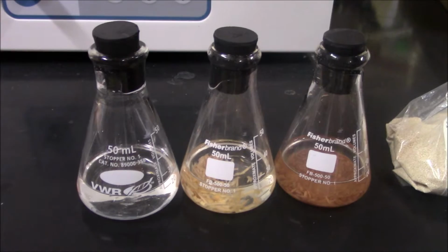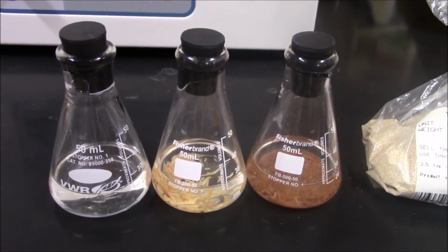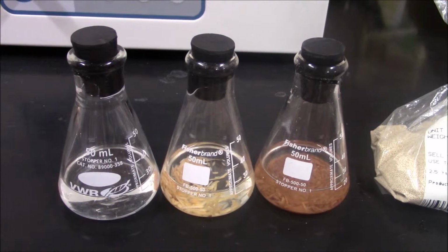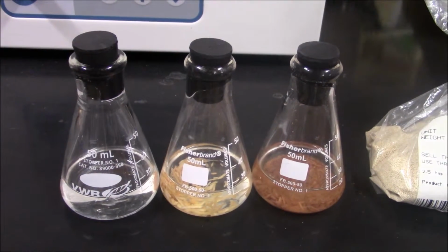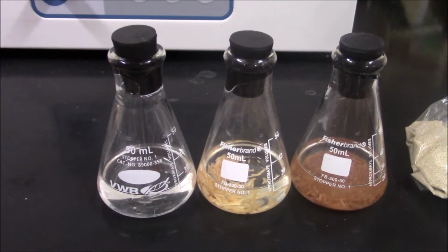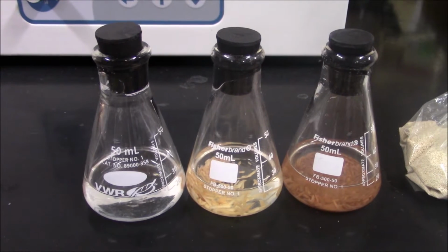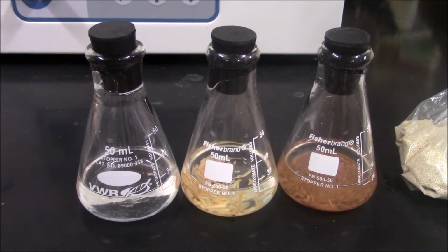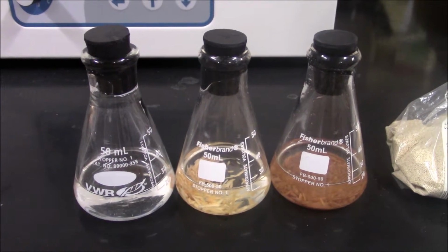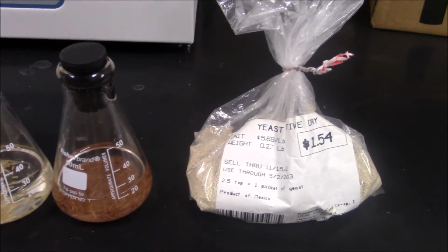The instructions for this experiment are written with the assumption that you will be making a new glucose solution for fermentation. It is also possible, however, to use a solution made during enzymatic hydrolysis. As you may recall, during this reaction, enzymes are added to the pre-treated wood chips to convert cellulose into glucose. In a real biofuel production process, yeast would be added at the end of enzymatic hydrolysis, or even during enzymatic hydrolysis, and fermentation would begin.